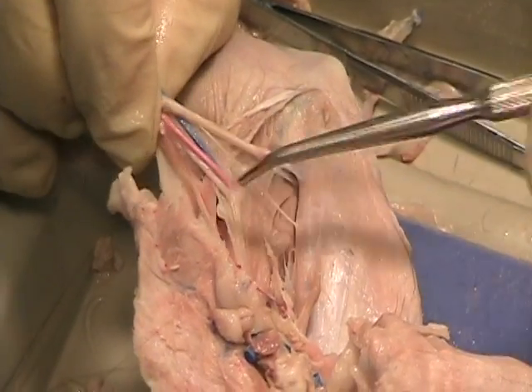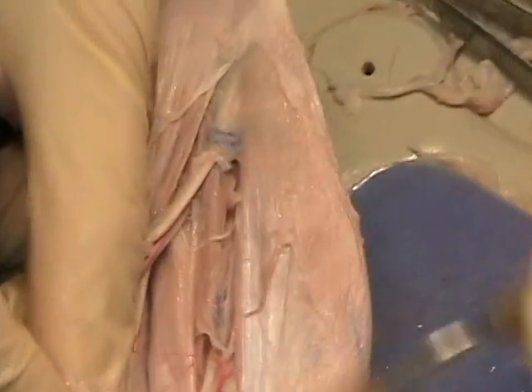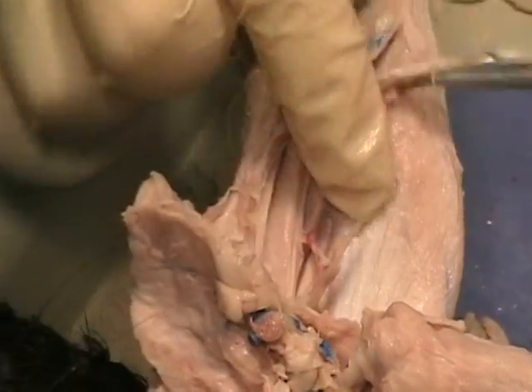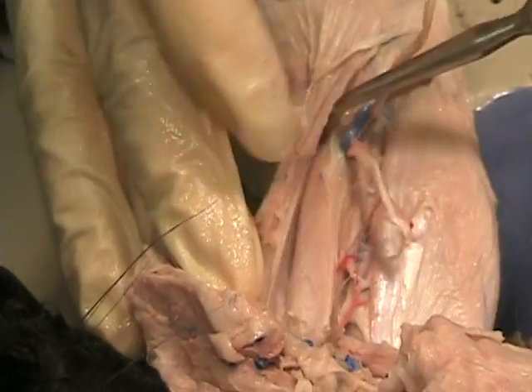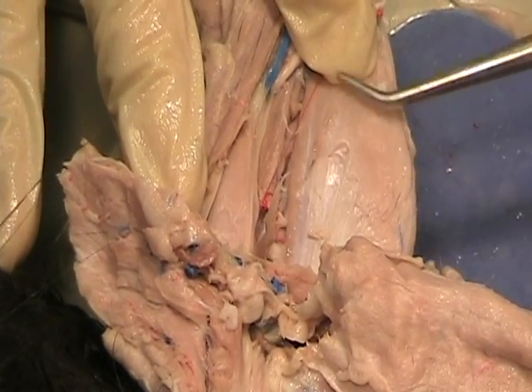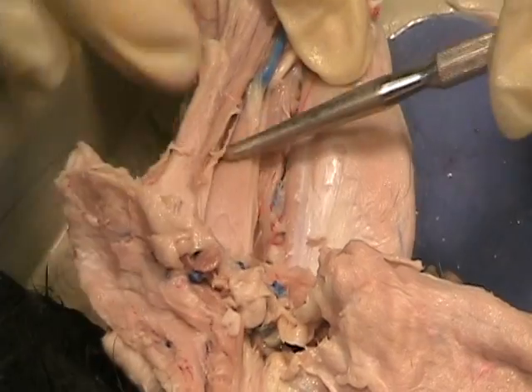This allows us to find our biceps. The biceps is buried all the way down in this little pocket, underneath all these veins and arteries. And here it is. Here is our long head. Here's our medial head of the triceps. And right next to that is the biceps.